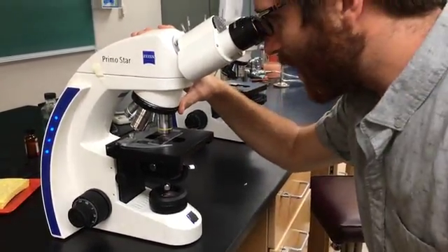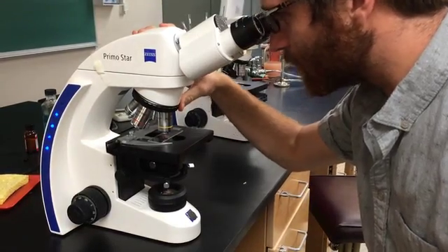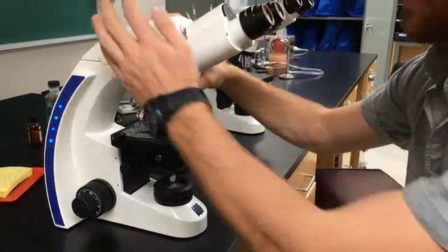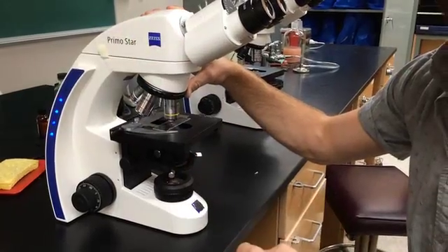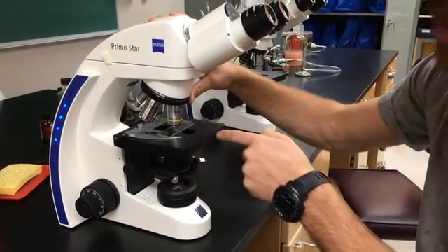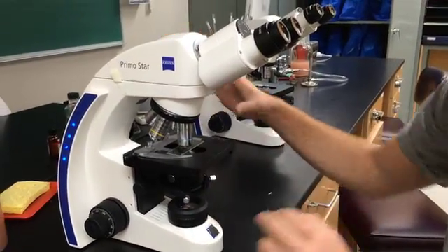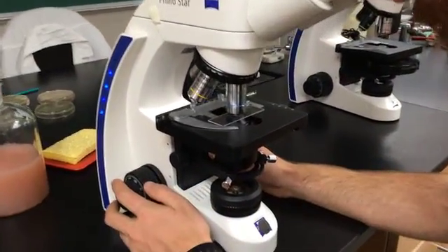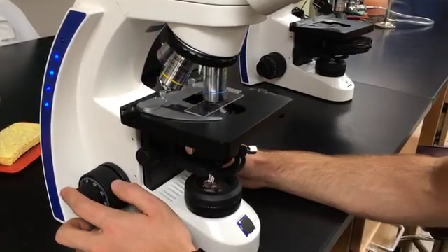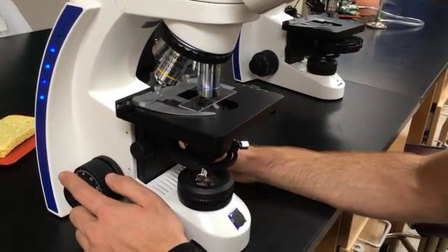Since my red X is still sharply in focus, and these microscopes are par focal, if I'm in focus at the 10x, I should be able to just swing the 40x in place, and the 40x won't hit my slide. And I'm going to look, and oh, it's going to just take a small minor adjustment. And now, yep, I'm in focus.